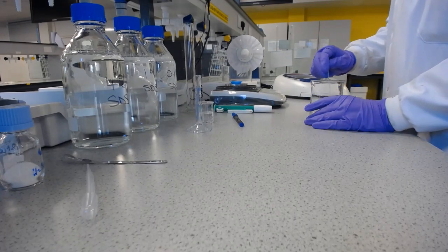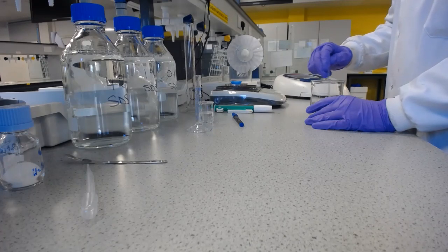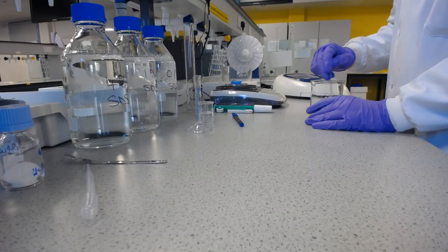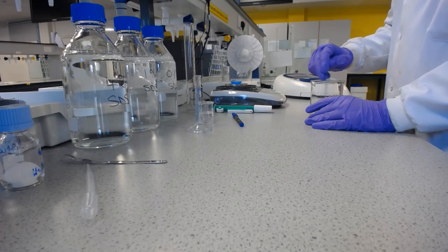What's important to think about here is we've obviously done a bit of prep work to know what concentrations are needed. And you will have noticed that I've put 8 milligrams into 100 mils of water here. And we put 200 milligrams into 3 millilitres for our saturated solutions. And so just by that, that's a clue that we put in way, way, way more than was needed, as we said we would.